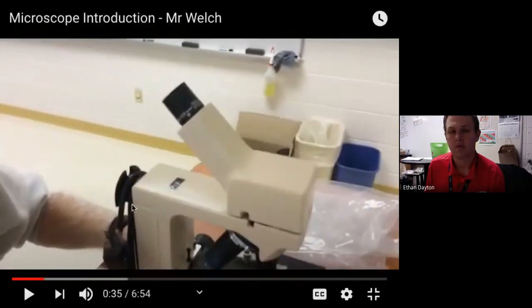So he just named about 4 parts right there. The eyepiece, the arm, the base is what it just rests on. The stage is what you put your slide on. The arm is what you grab it by, and the base. And then you have, of course, the eyepiece, which you look through. Okay? So he named about 4 pieces. If you didn't do the discussion, this would be very helpful for you.